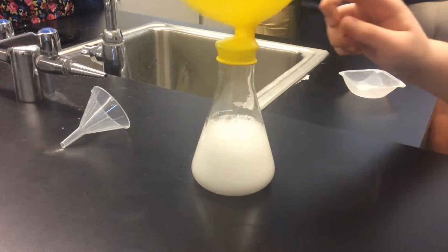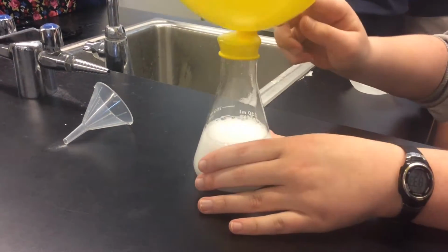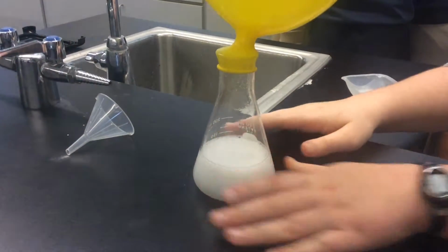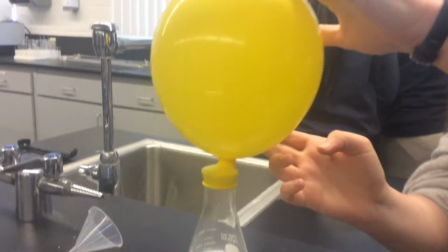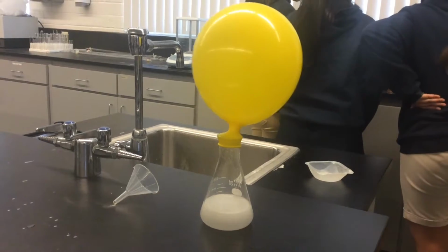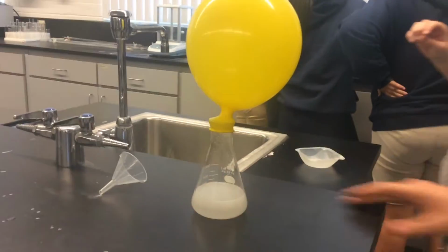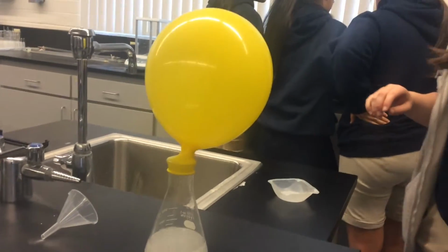There's still stuff on the side. Oh, good lord. Does it feel cold? It's cold. It didn't go all the way up. Is that it? Do you feel the temperature? Yes, it's cold. There's stuff on the side that's not going in, I guess.